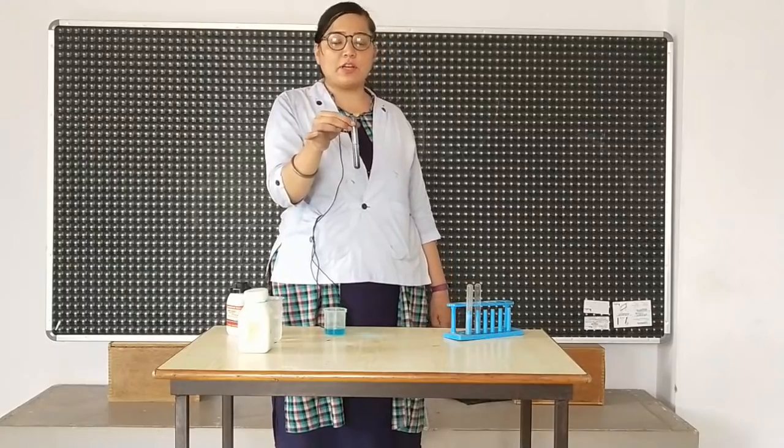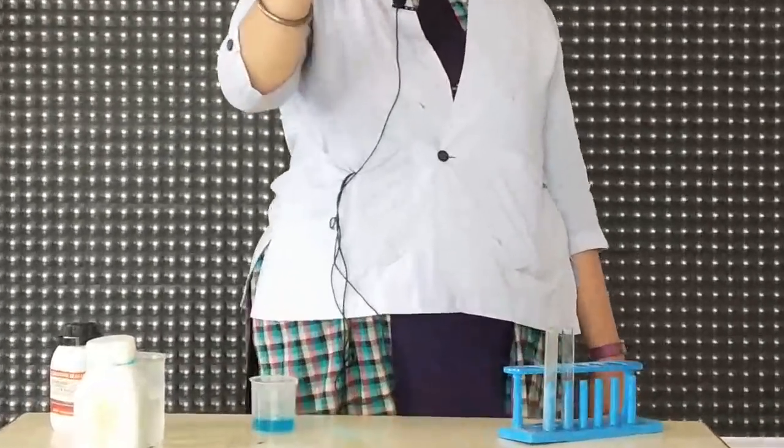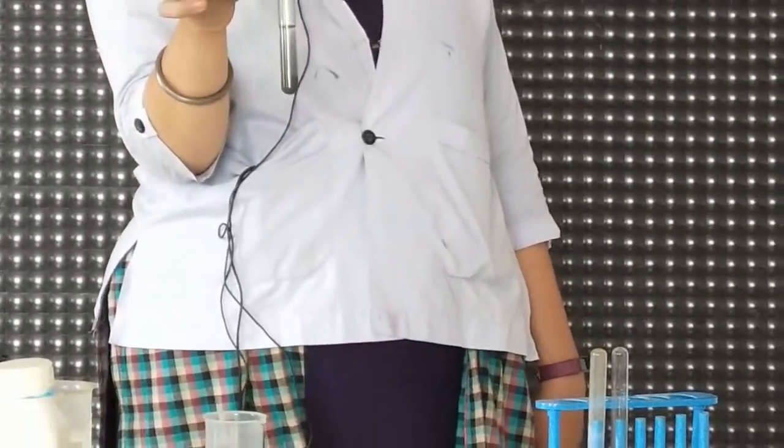I hope you are seeing it as a colorless solution. So let's wait.